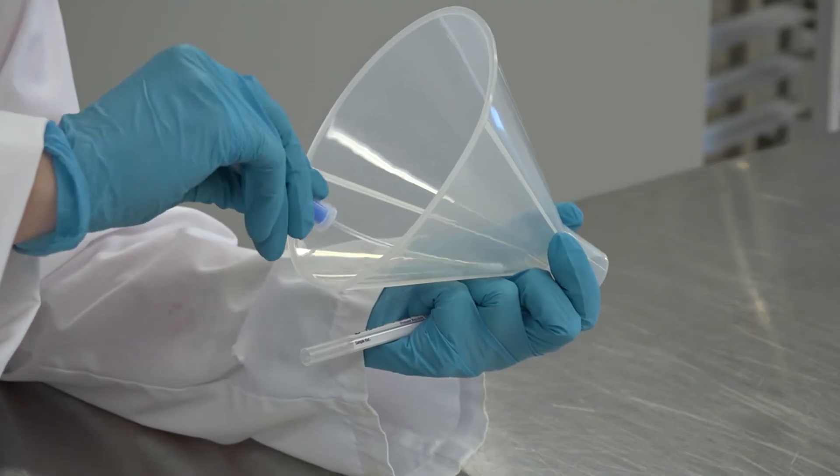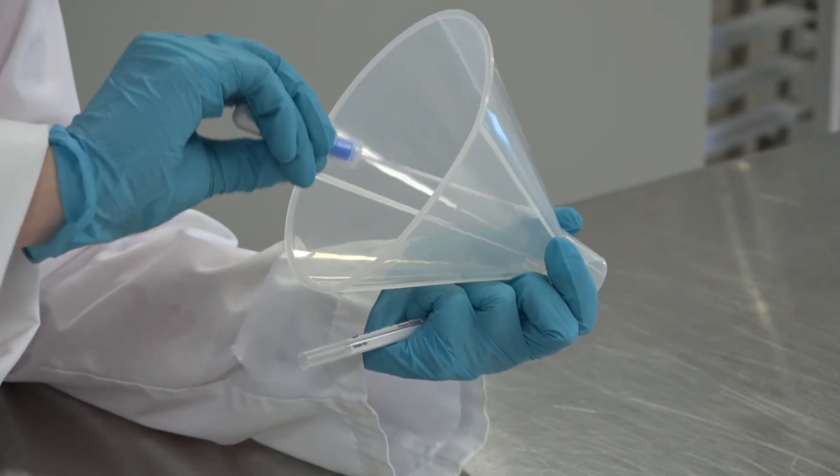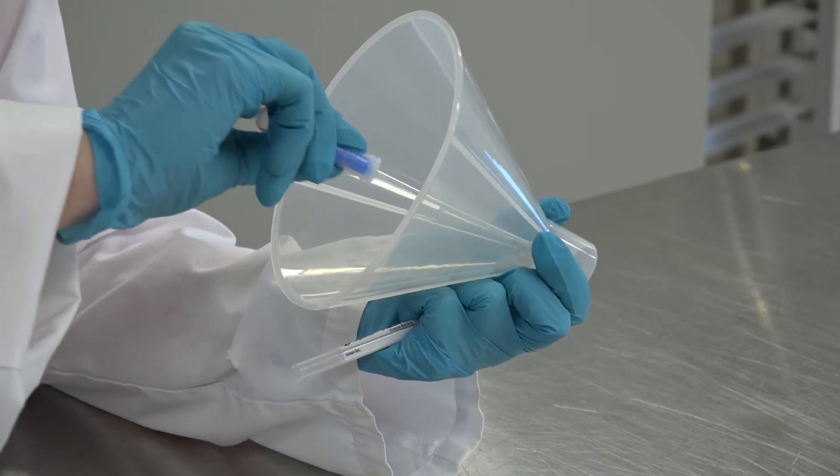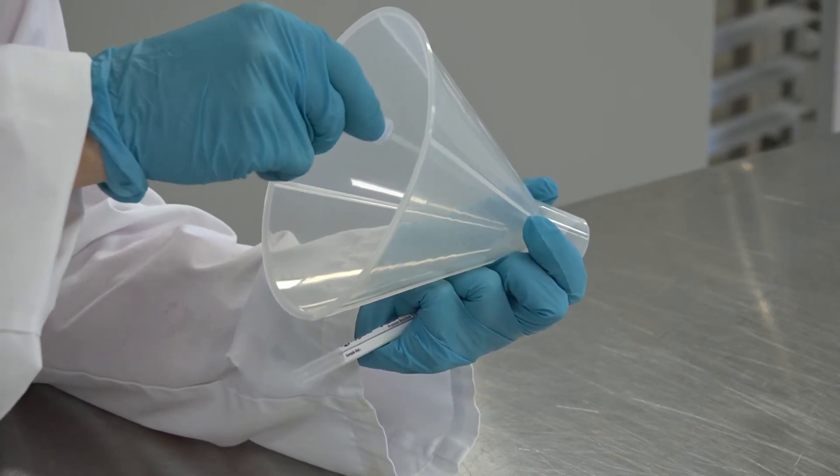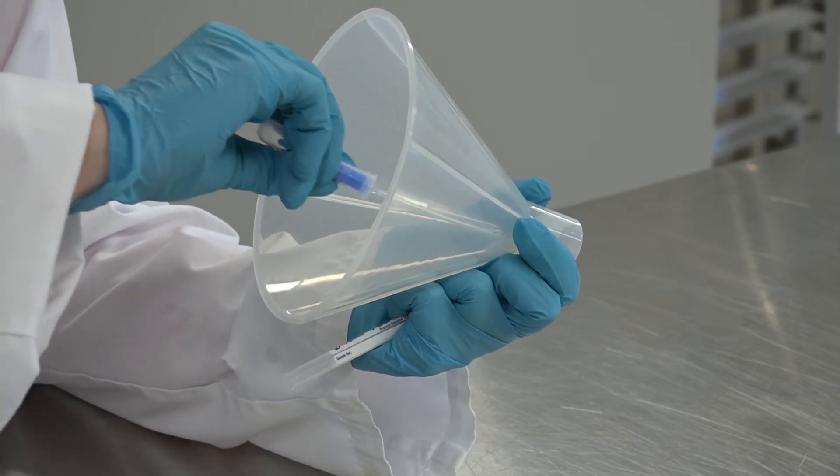When swabbing an irregular surface, ensure the swabbing technique is consistent and a large enough area is swabbed using even pressure rotating the shaft of the swab.